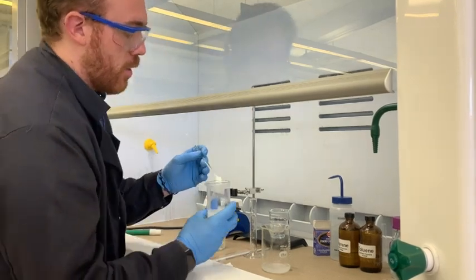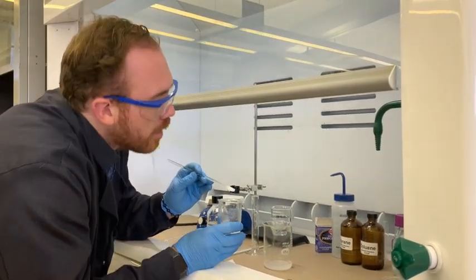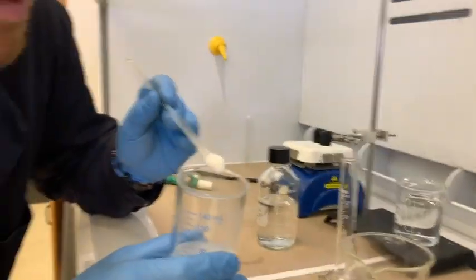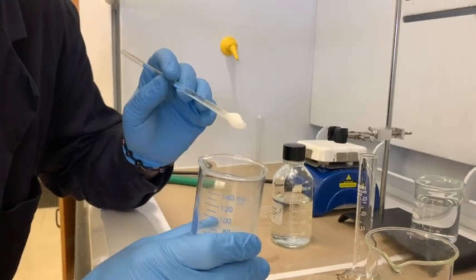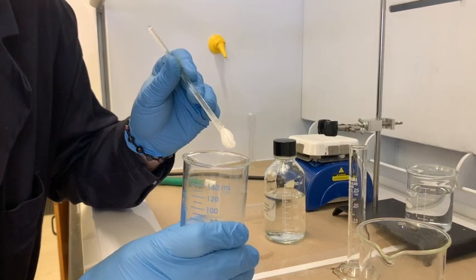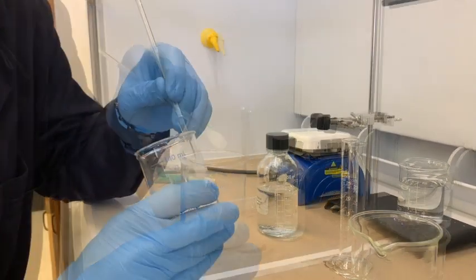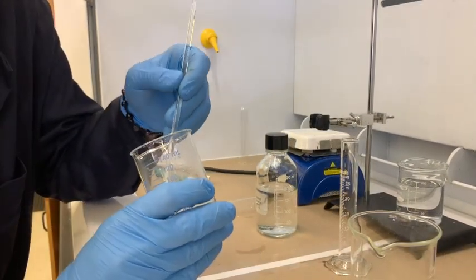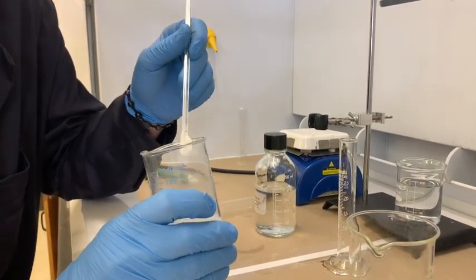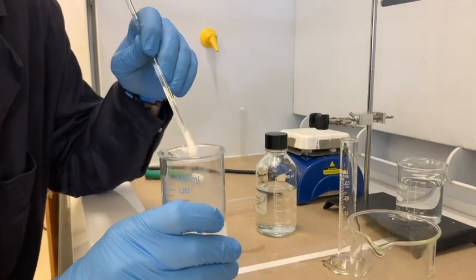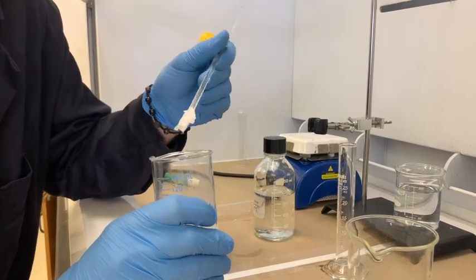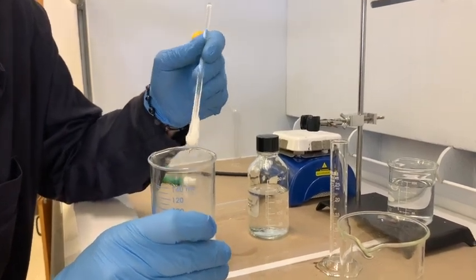It is worth noting though, in your notebook, what the color is, the consistency, and whether you think it's looking waxy or crystalline. I would say on the inside of waxy here. So maybe more amorphous, less crystalline. So there are more chunks inside of here that are just too small and they're not attached to this larger chunk. But it's also soft and gummy. That's worth noting. Material properties are not brittle or anything.